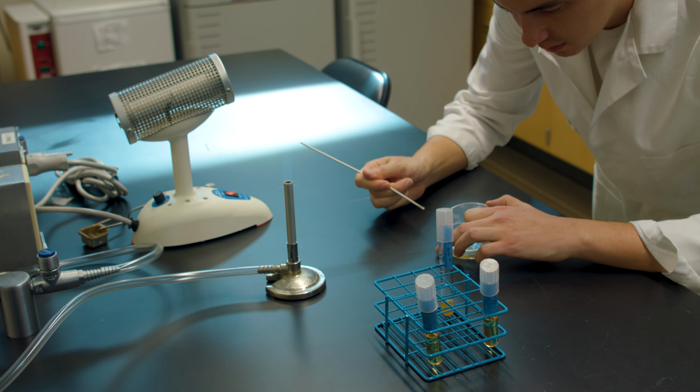Start Bunsen burner. Touch the organism on the TSA plate with the sterile, cool, inoculating loop, while keeping the plate lid at an angle to avoid contamination. Remove the lid of the test tube media you are transferring to, and run the tip of the tube through the flame of the Bunsen burner.